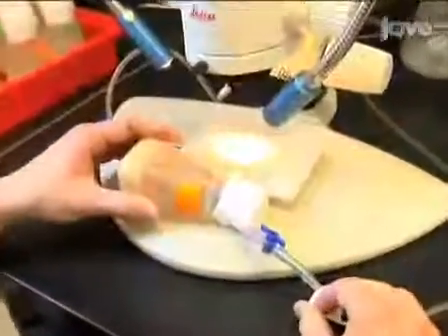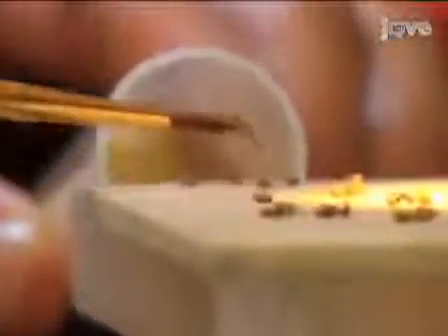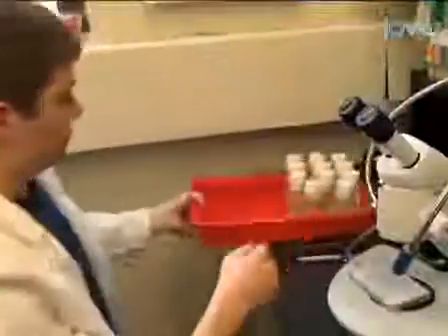Collect the flies 1 to 3 days after eclosion. Use a carbon dioxide diffuser to sort flies into test tubes containing yeast-free media. Sort 10 males per test tube. Wait at least a day or two after use of carbon dioxide before running the behavioral experiments.